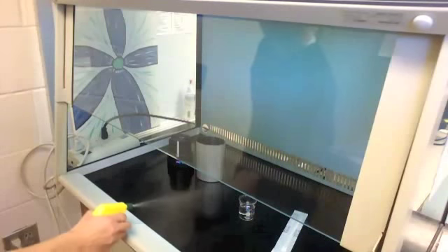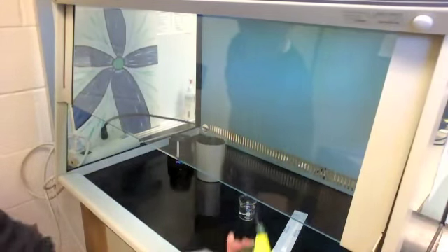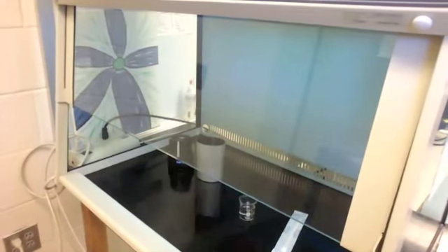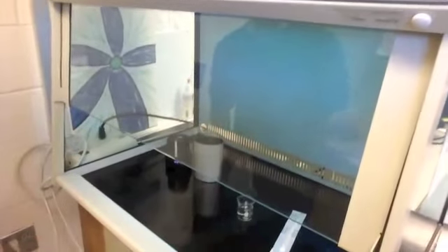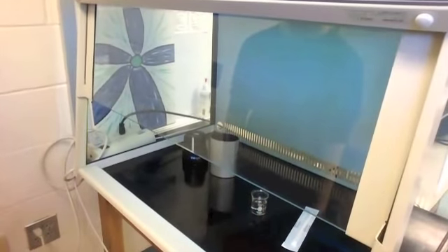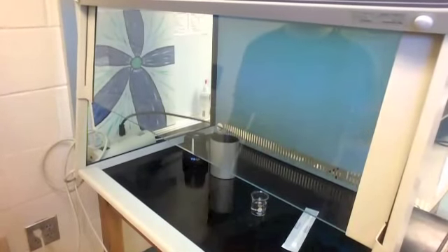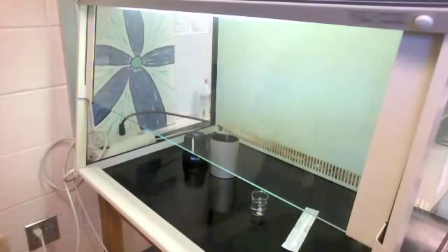As you can see, I'm spraying everything inside the laminar flow hood with ethyl alcohol — a very generous coating — so you can be assured that the bacteria inside is pretty much killed. I did a cut there because it took a while to get gloves. Currently I'm readjusting the camera and turning the normal light on, thus turning off the UV light.